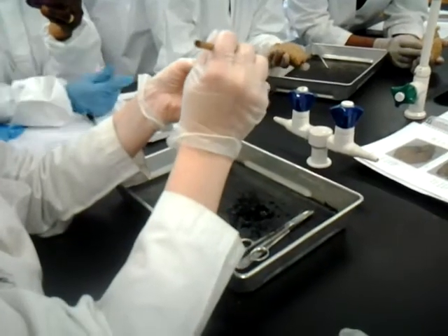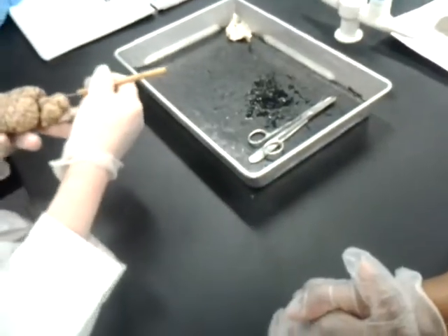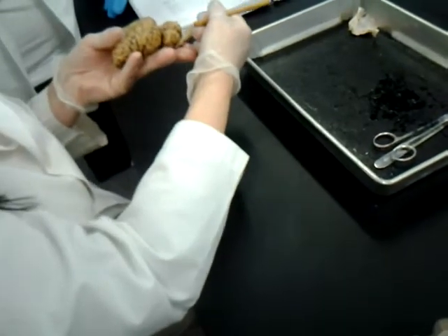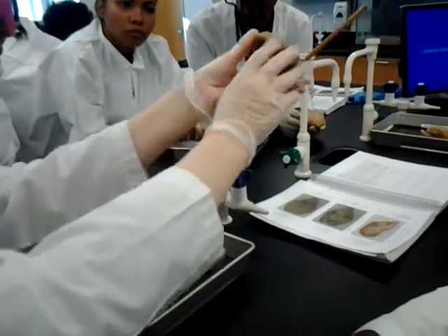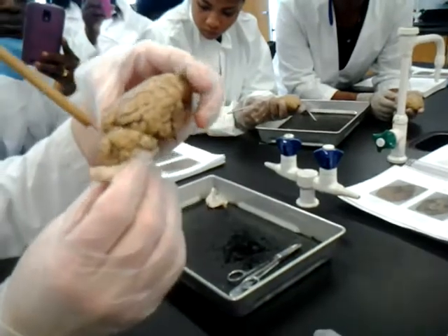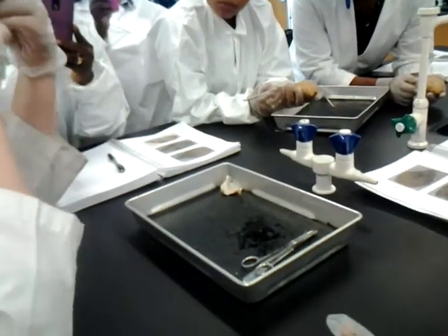The middle of the cerebellum is the vermis, which in the sheep is very large. It goes from here to here. I'll stick my pointer right in the middle. That is the vermis. When you cut the sheep brain, you will be cutting right through the vermis. Now remember, in the human brain, it wasn't that visible. Now it's big and it sticks up, actually bigger than the other parts of the cerebellum.